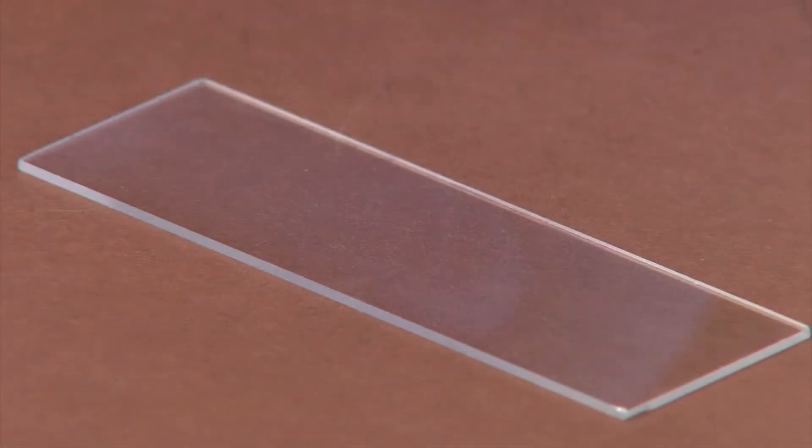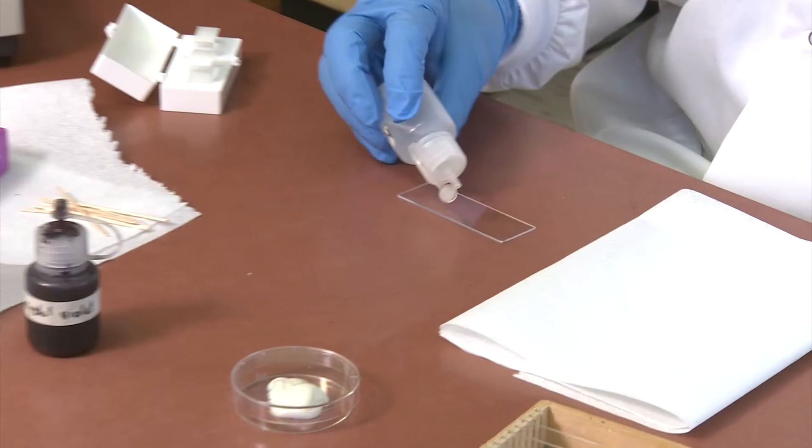First, obtain a clean microscope slide. Place the slide on a flat surface. Place a small drop of water on the slide.